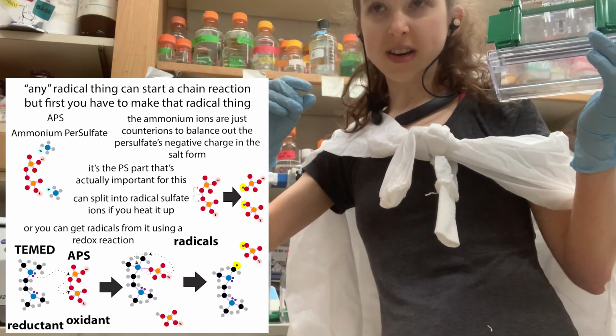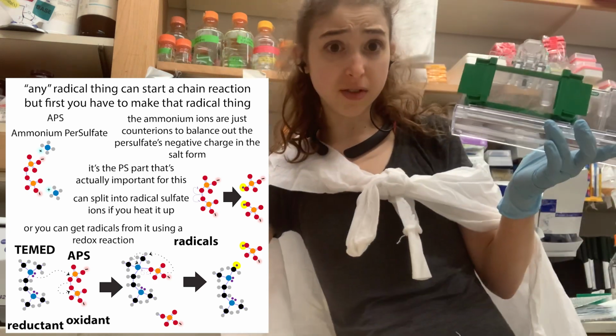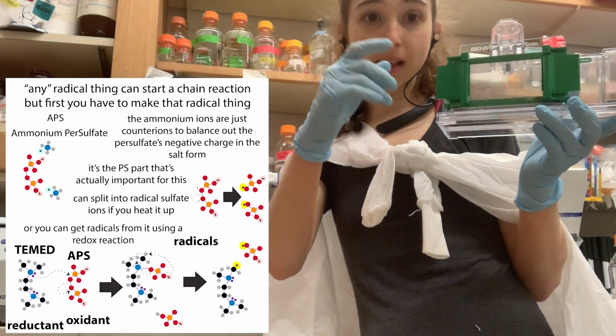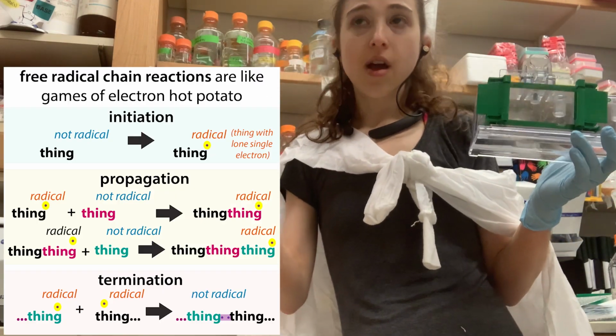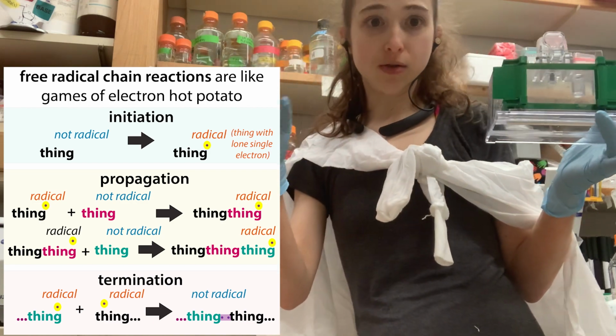We use it in the hood because it smells really, really bad. So we do that part in the hood. But you don't want to add that until right before you're ready to pour the gel, because once you add that, it's going to start this chain reaction. And this chain reaction is a radical reaction.